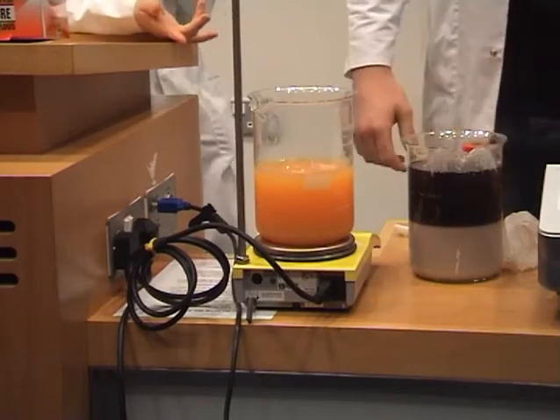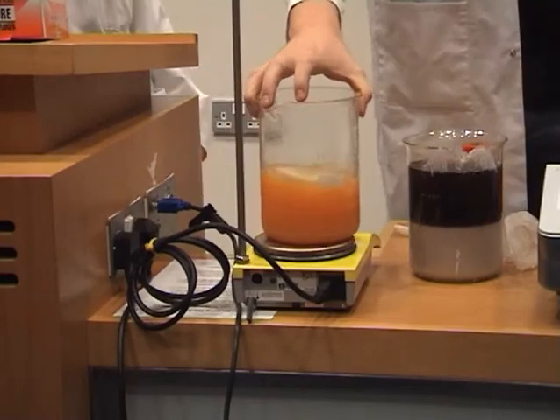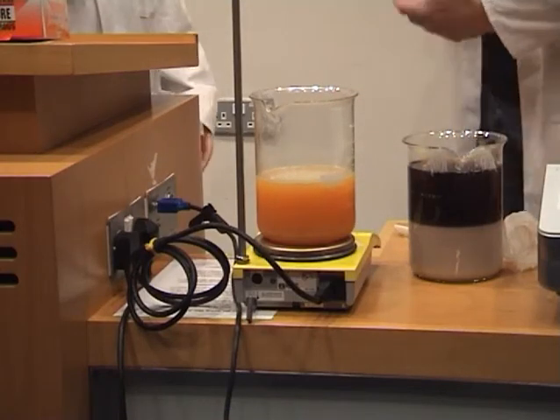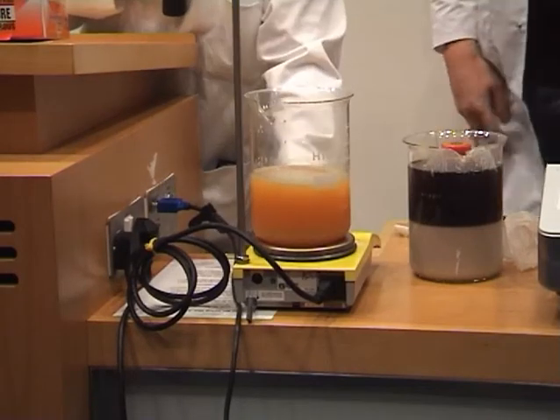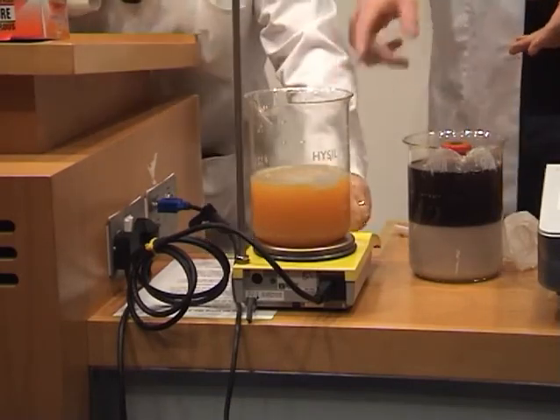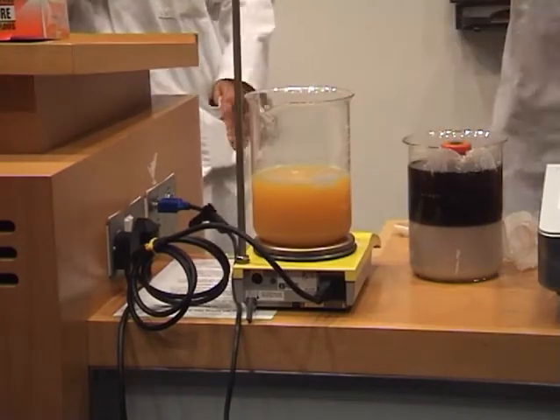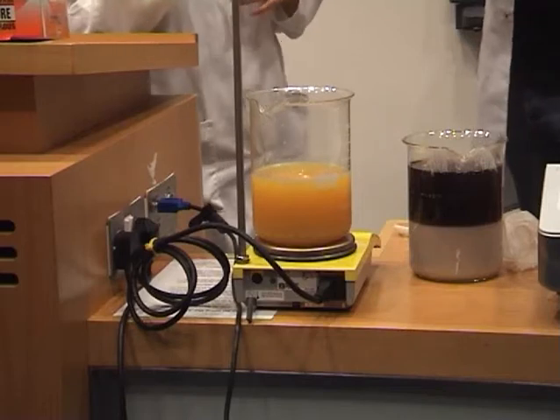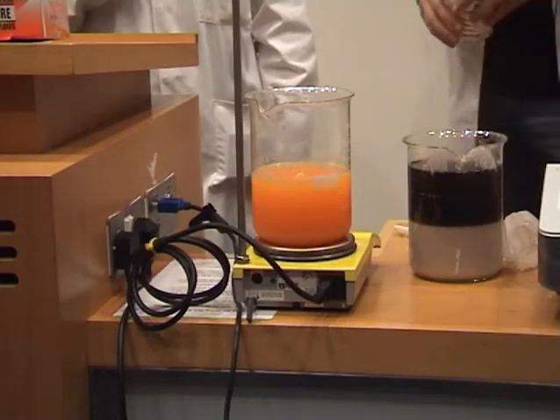What's going on here? All right. Okay. Daniel, what did you put in there? What was in it already? Magnesium hydroxide. Okay, magnesium hydroxide and you put it into acid. So it's a base and an acid. Where are we getting the colour from? Well, the yellowy green is the basic colour, and then when it turns bright red, that's the acid. Did you put an indicator in there? Yeah, the universal indicator. Okay. Right, we've got red again. And now it's gone.